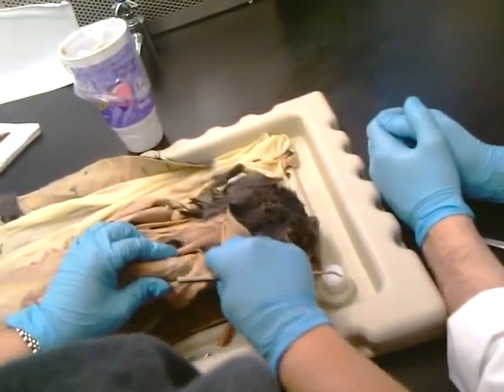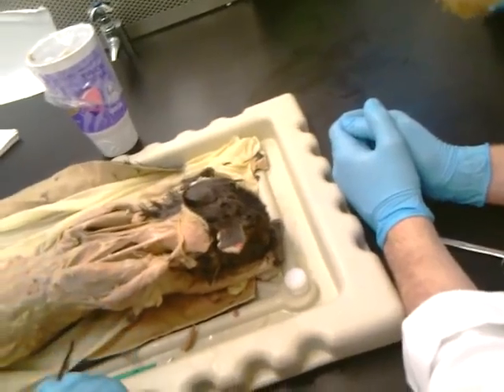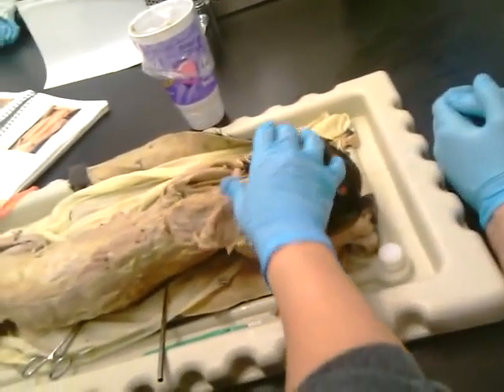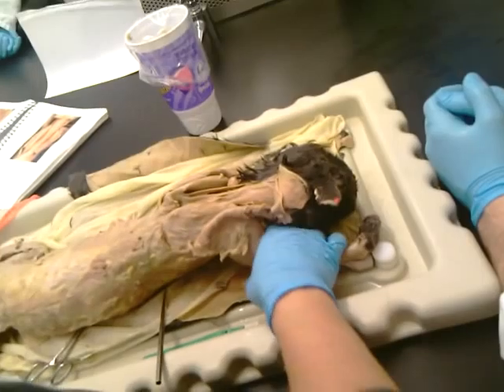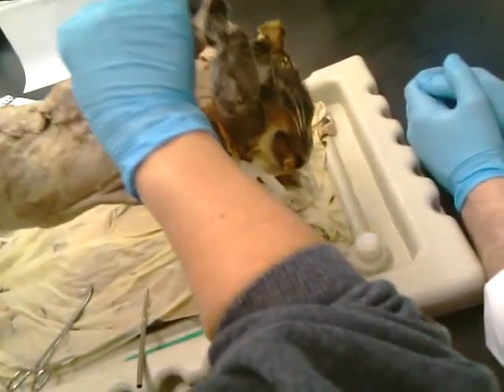Okay, now we really haven't found a levator. Were you able to find anything in there? We really haven't found any of those on any of the cats, so I wouldn't worry about that one. Because we haven't found it on any, I'm not going to test you on it. Now we do need to go to the abdominal muscles, though.